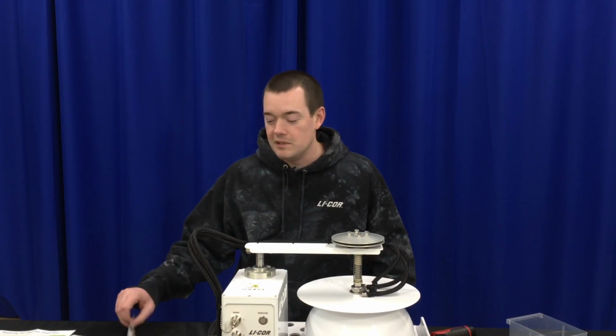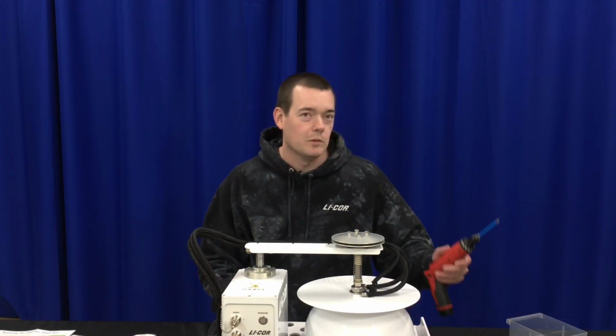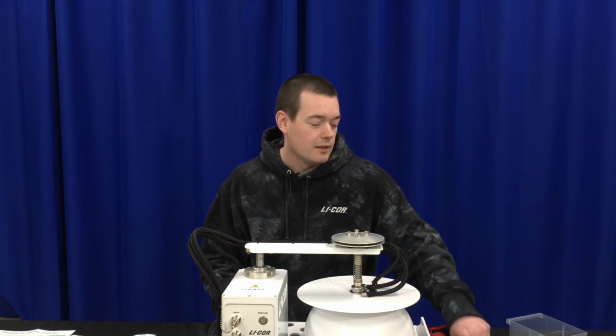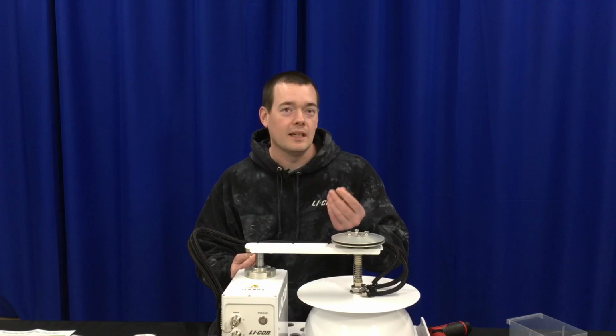All the hardware you need is included. The tools you'll need are a number 1 Phillips screwdriver, 3/8 wrench, and 9/64 hex bit.